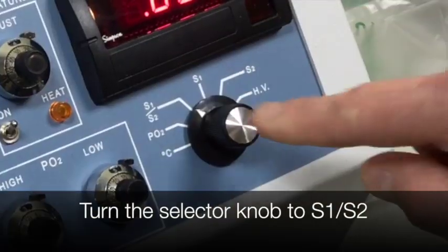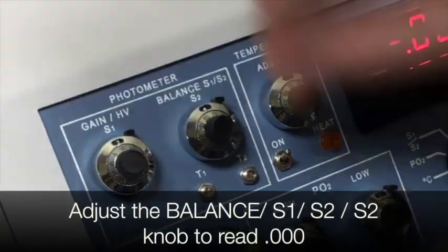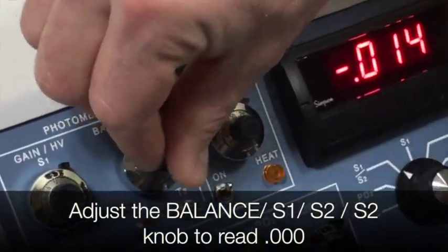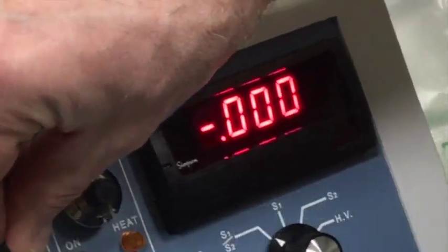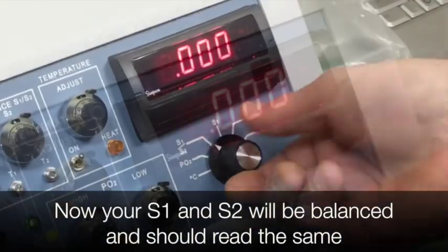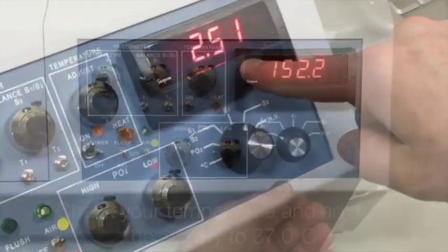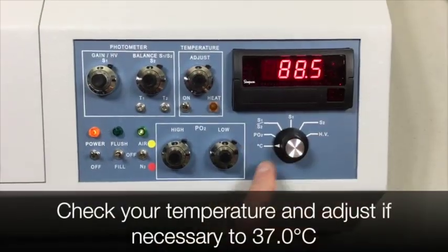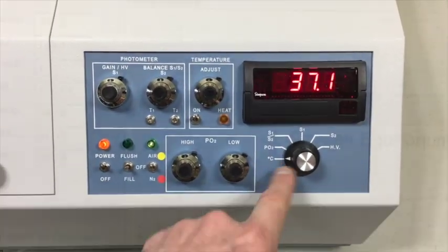Turn the selector knob to S1 over S2. Adjust the balance knob to read .000. Your S1 and S2 should be balanced and should read the same. Check your temperature and adjust to 37 degrees Celsius.